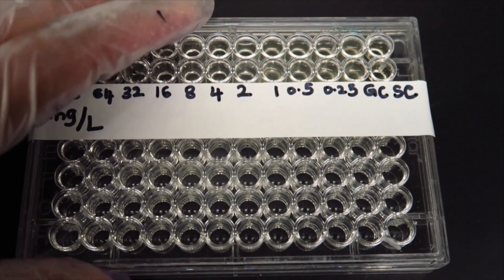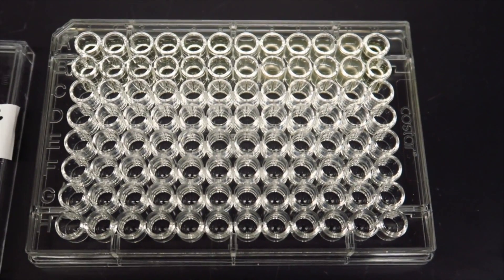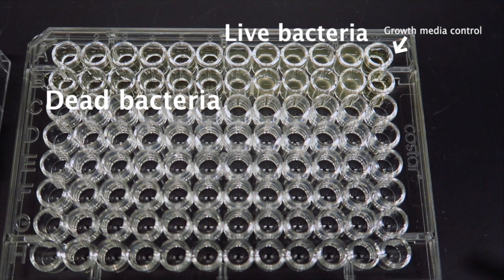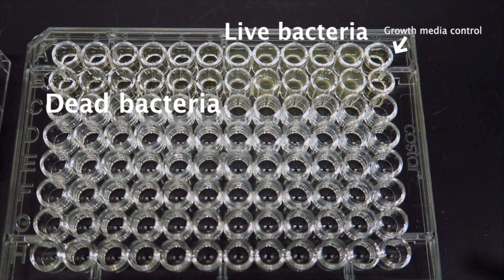Turbidity indicates bacteria growth. The effective drug concentrations stop bacteria growth, as indicated by clear wells.